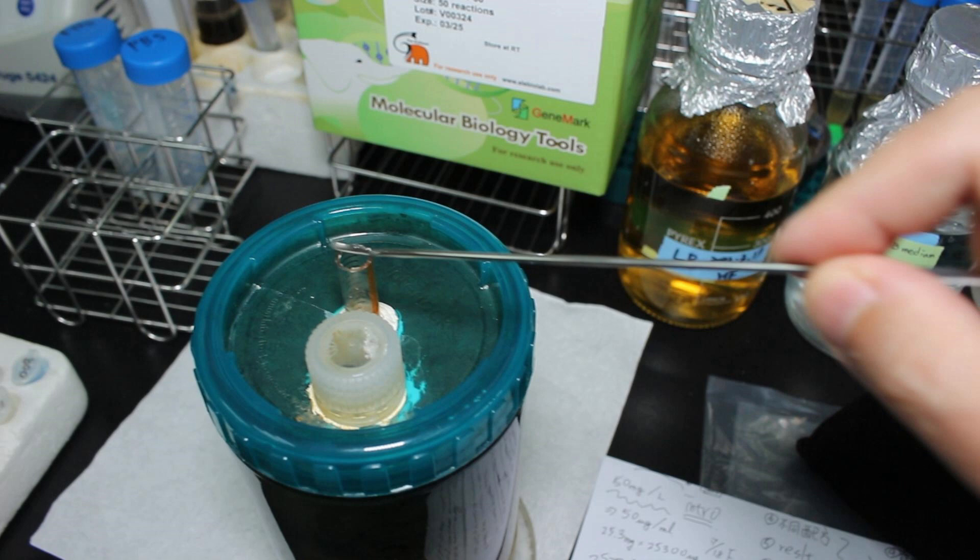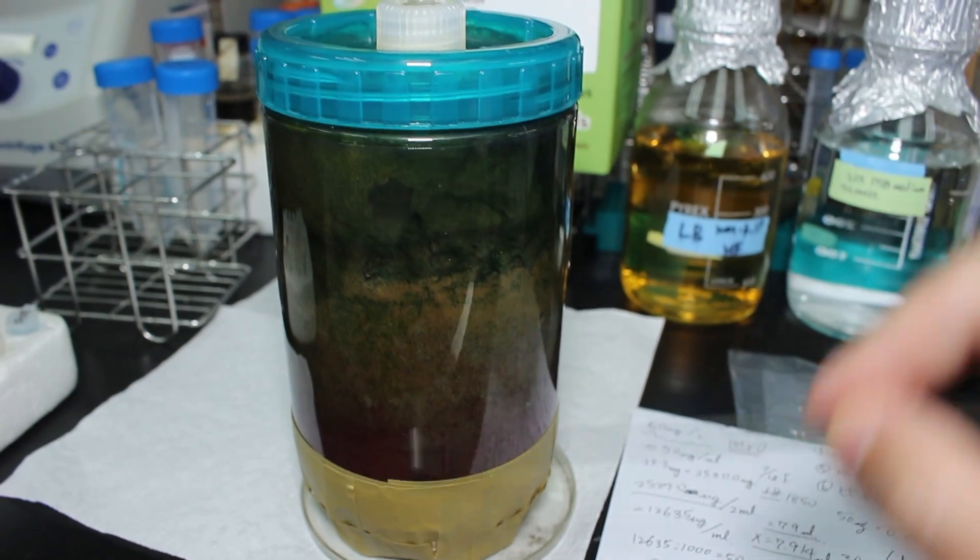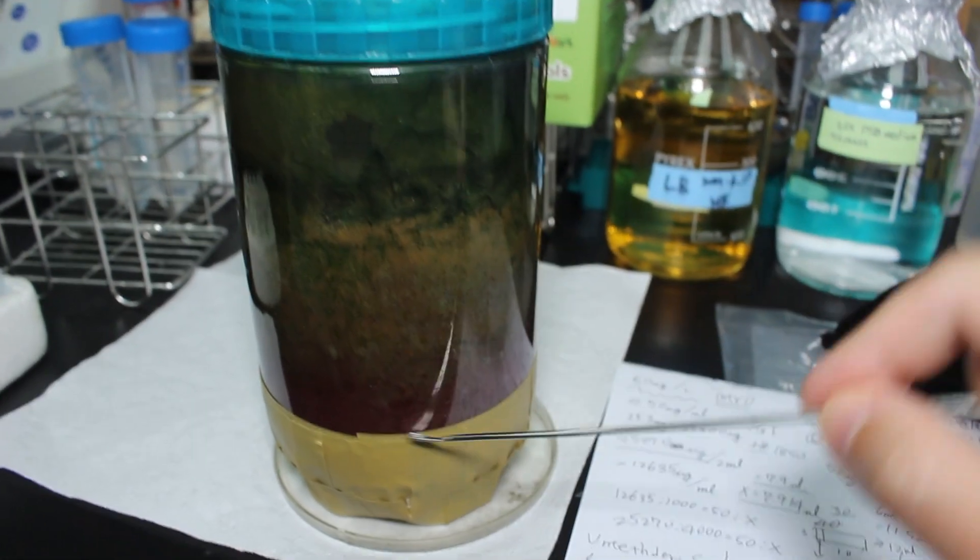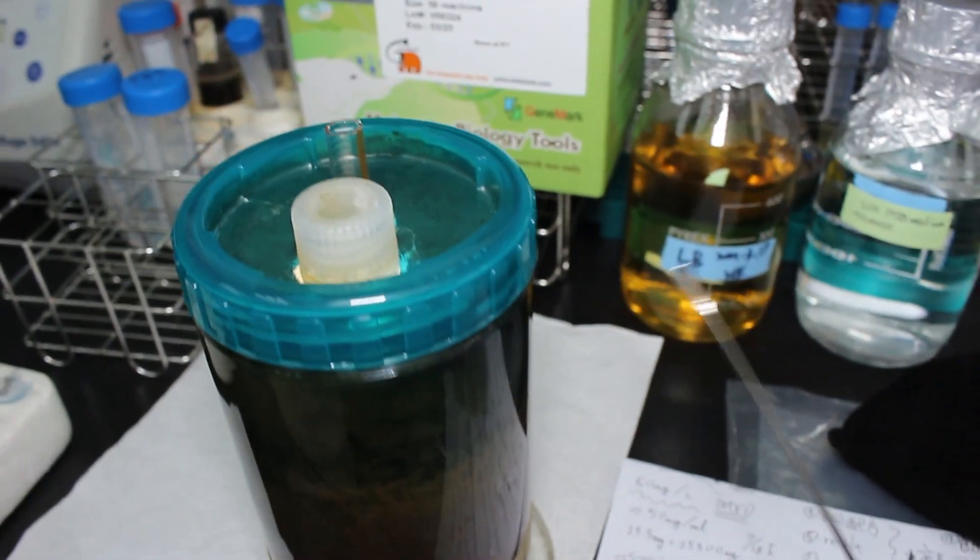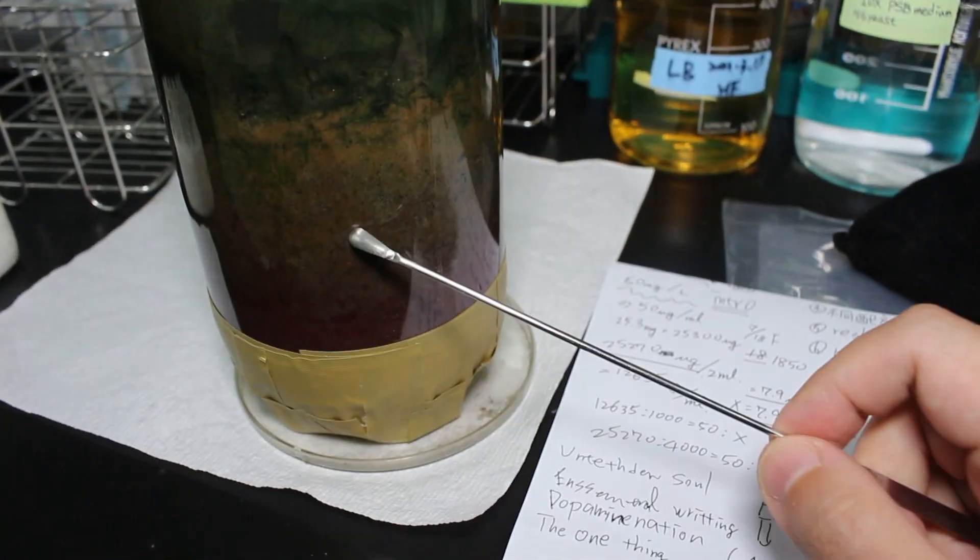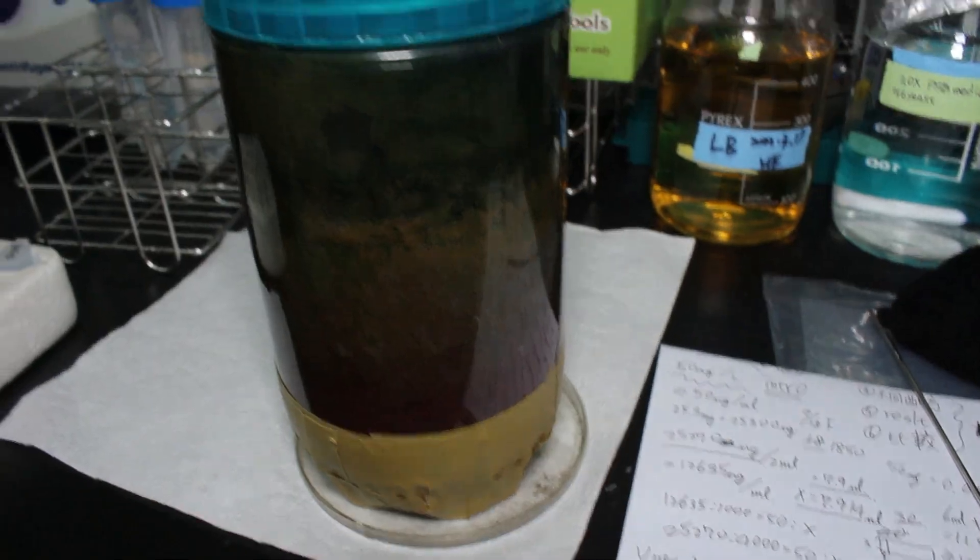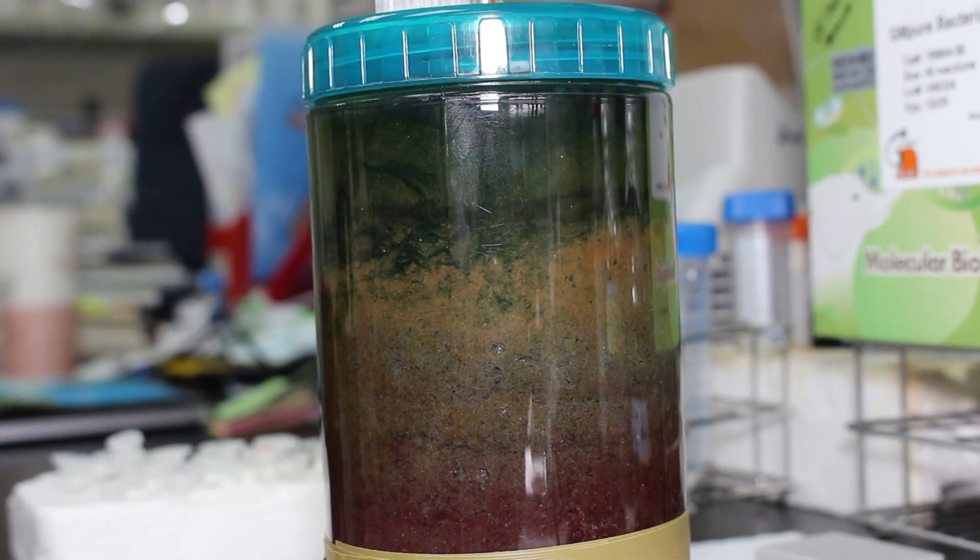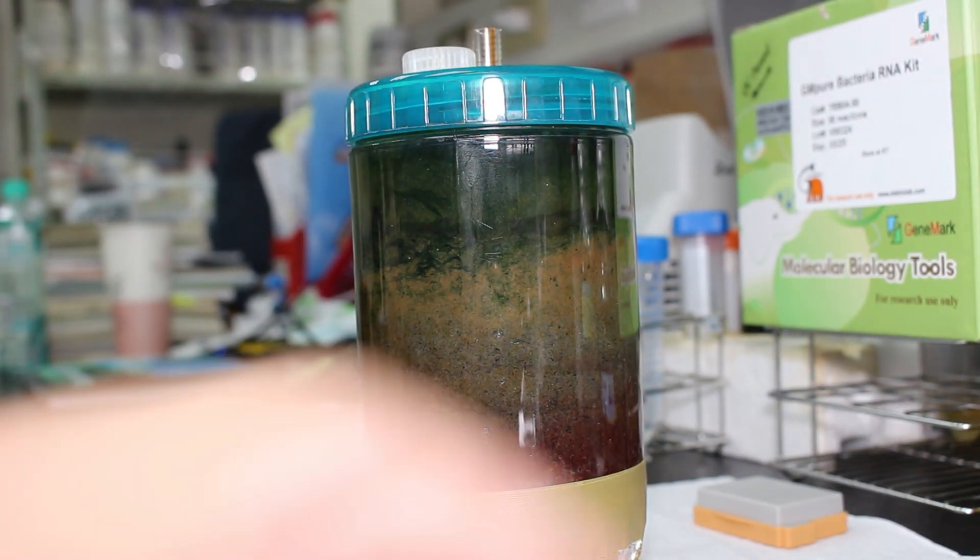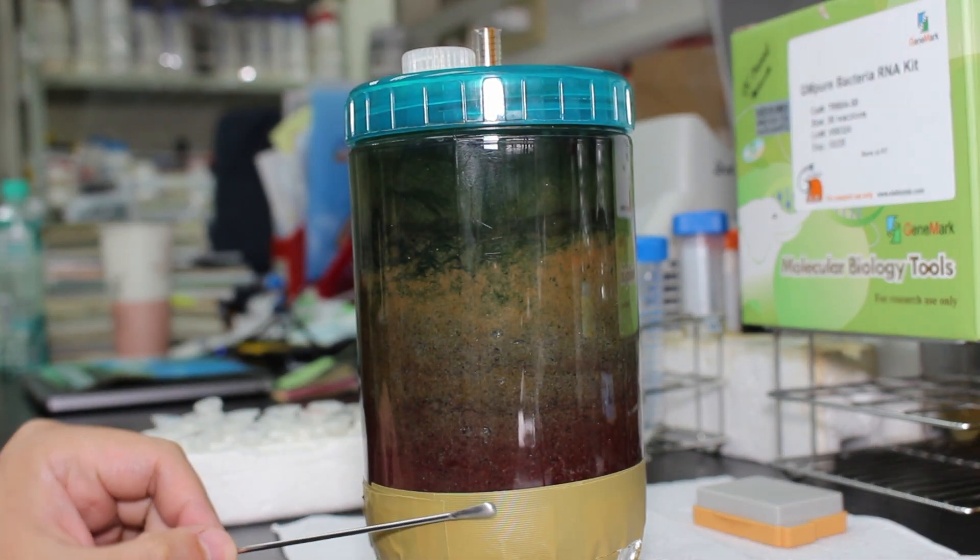The whole bottle preparation is the same as before, the Winogradsky column. It's just this time, I wrap the part of the bottom so the light will not penetrate it. I wrap it around with foil, paper, and tape, so the light cannot penetrate it. That will be the layer which in the future I intend to add nutrients directly to. And this time, the bacteria grow quite fast.